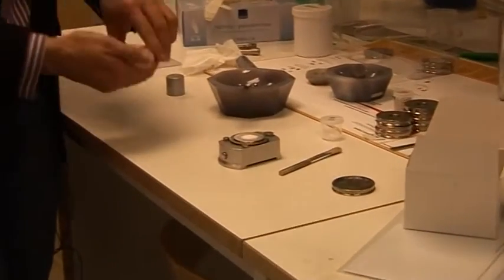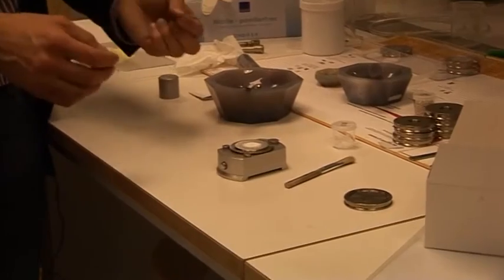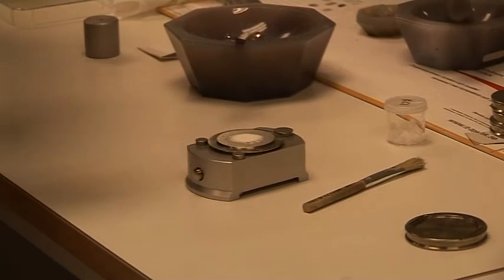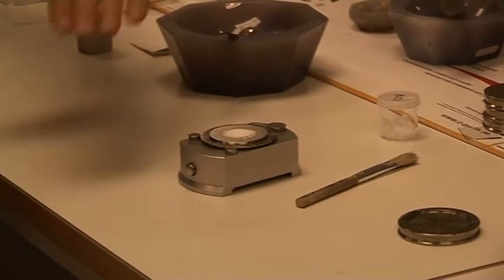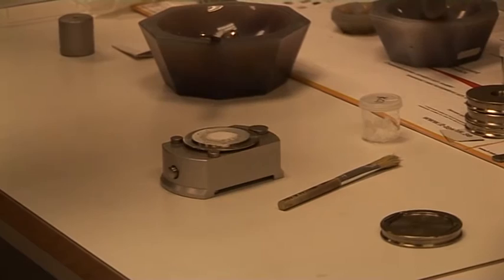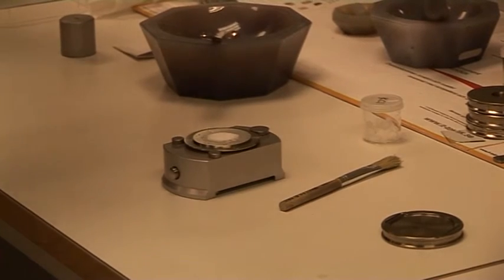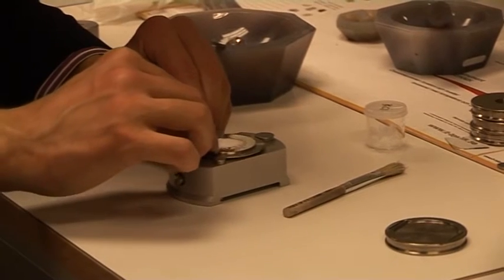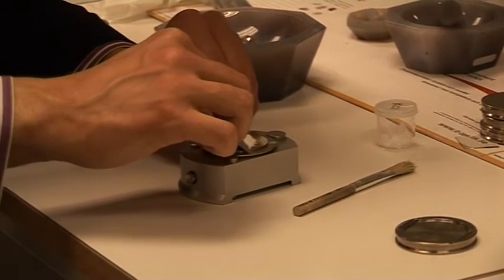Then we just take excess with this knife to close it nicely with the bottom part. It's good to have it as flat as possible on this side so then the upper side is not falling down because of any roughness or unevenness.